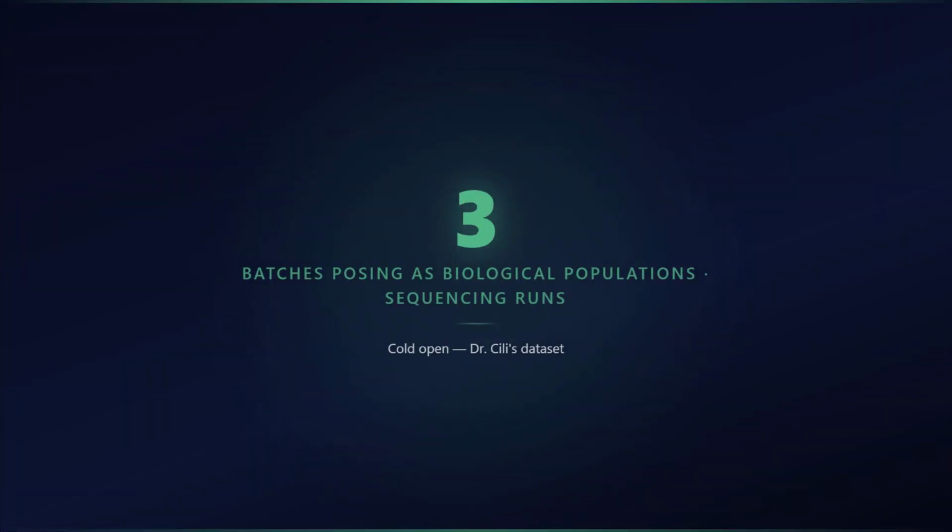Same protocol, same sequencer model. Different run dates? 3 separate runs, but the technical variation should be minimal. Color your samples by run date. They map exactly onto the clusters.